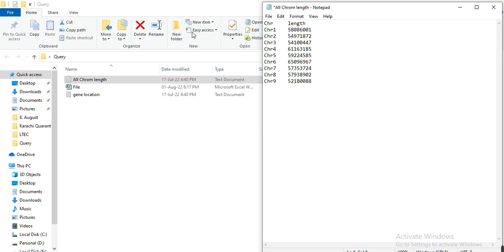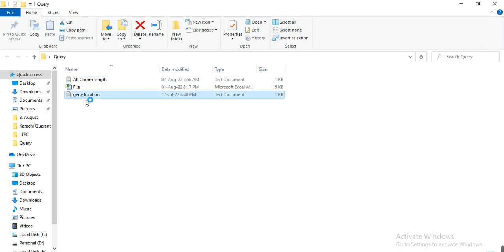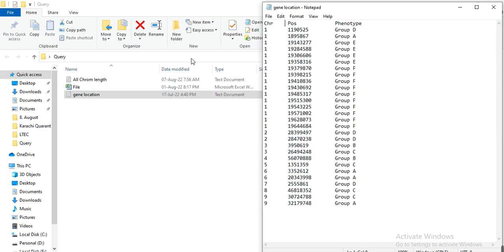Here is okay. So we have removed the space between these two columns and only pressed one tab button from the keyboard. Also we check this gene location file, and here you can see that between these two columns there is a space, 1, 2, 3, 4, 5, meaning 5 space bars. We don't need this space, we only need one tab. And here also you can see between this position and phenotype column there is also a space, so we need to remove this space and press the tab button.